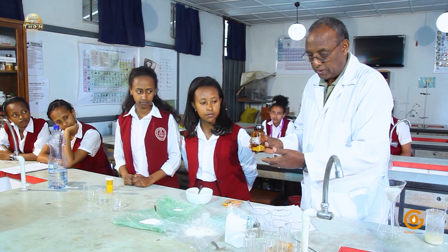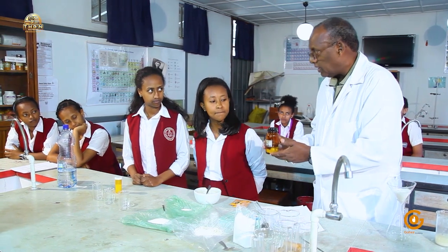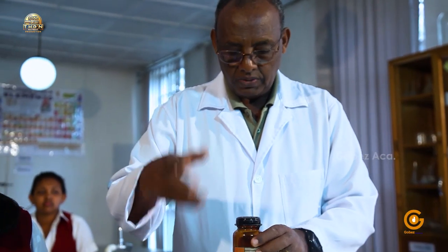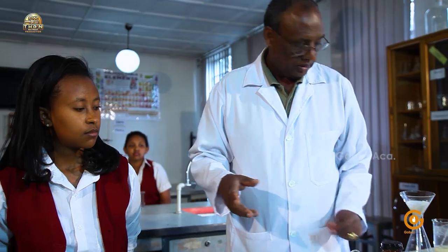From the outset, I would like to assure you it is not a physical process, it's a chemical reaction where sodium metal reacts with water to form sodium hydroxide and release hydrogen gas. We'll try to see if the gas really pops, which is the test for hydrogen.